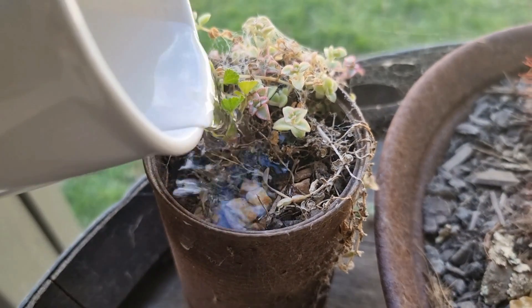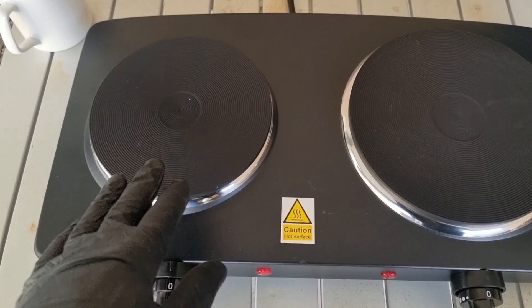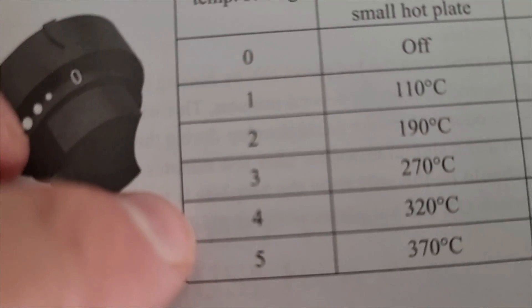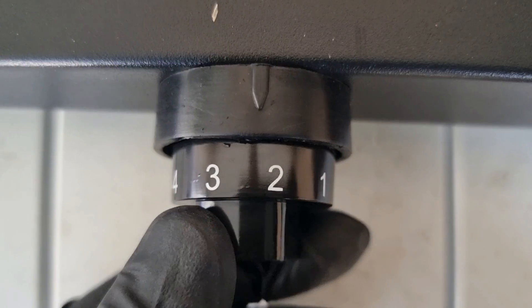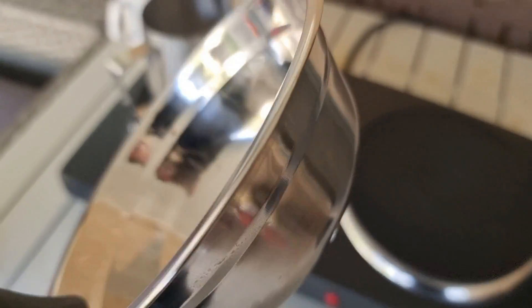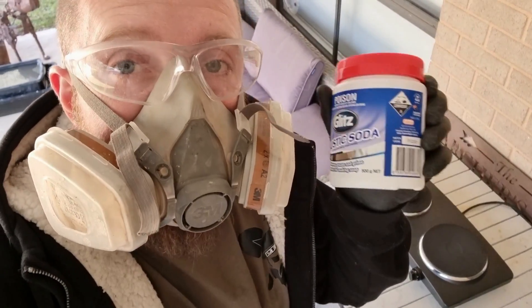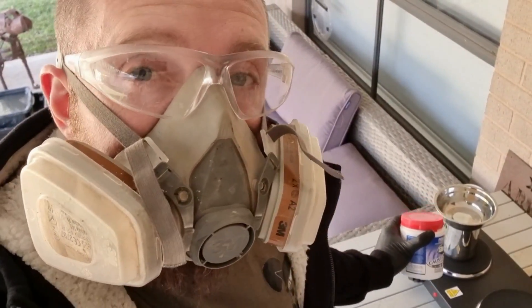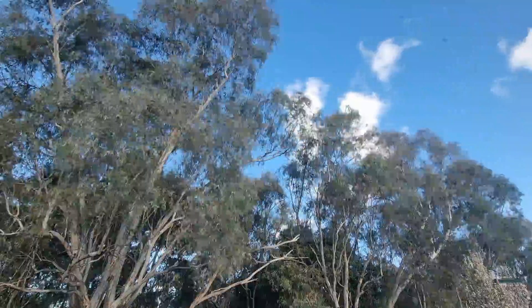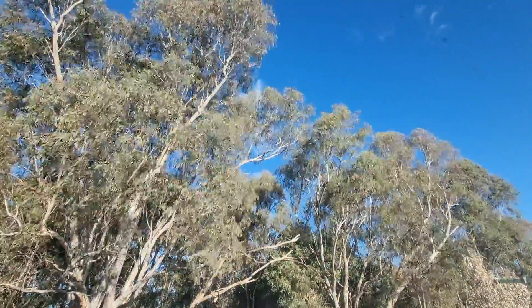We need that to reach a temperature of over 300 degrees Celsius. The small hot plate apparently reaches 320 degrees on setting four. We're going to put the bowl on top just to stop any splatter, and once it comes to a boil, we're going to let the caustic soda do its thing for about an hour. It goes without saying — other than PPE, you want to be doing that in a well-ventilated area. So I'm going to let that chill out for the next hour or so, and then we'll check back and see if we have pure gold with no quartz on it.